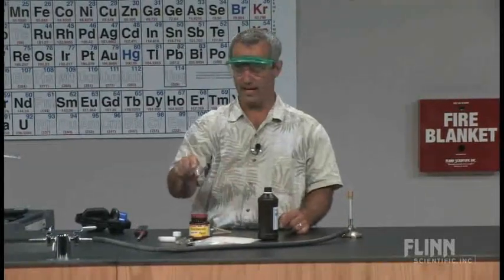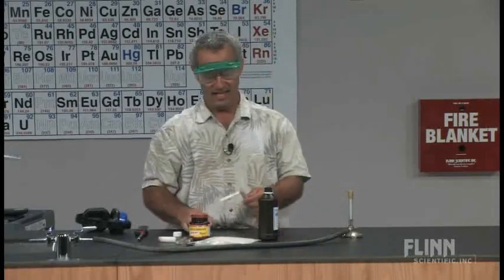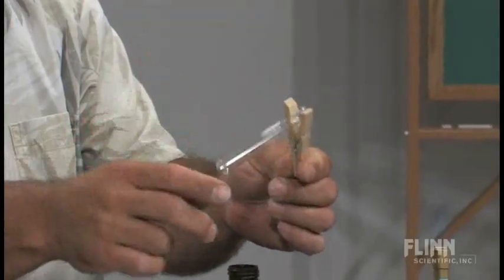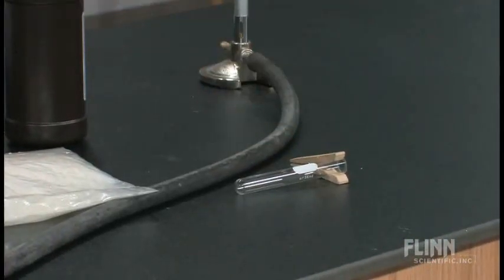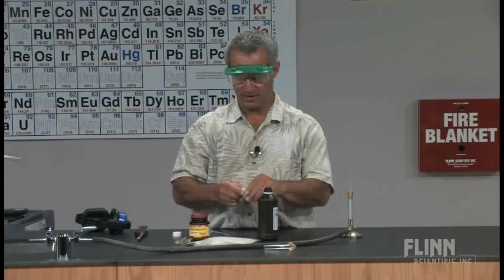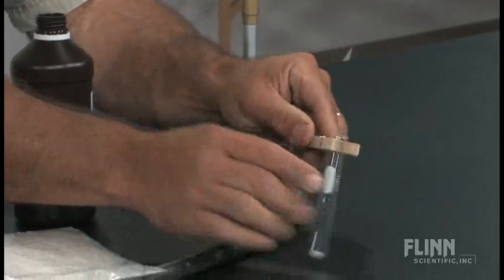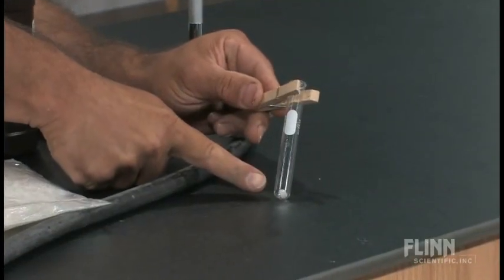On the other end I've got a test tube — it has to be Pyrex — and I'm going to put into that test tube a little bit of candle wax. I'm just going to literally break off a piece with my thumbnail. Doesn't take much, so you can see how much candle wax I've got in there.